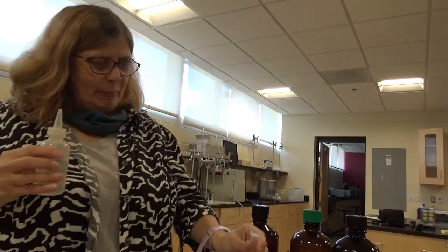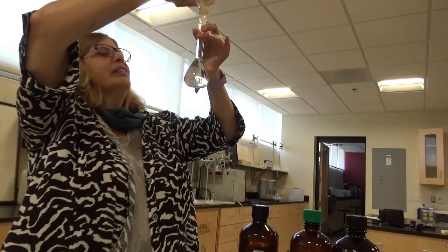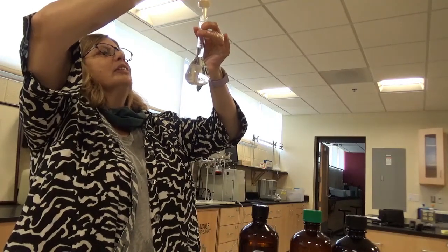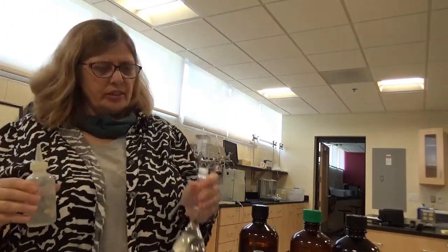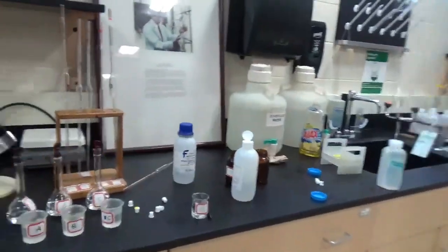Good. All right, so you've seen this before. There's no need for me to show you this 5 times. You've done it all yourselves. I have to admit, I don't do this very often anymore, so having to do it this summer, it's a good refresher course.